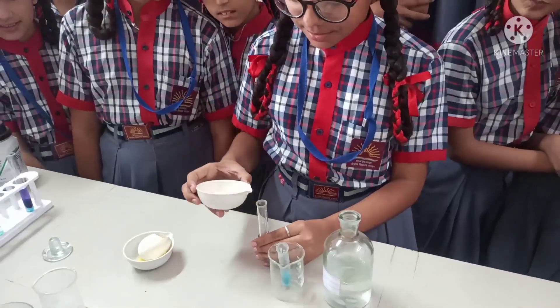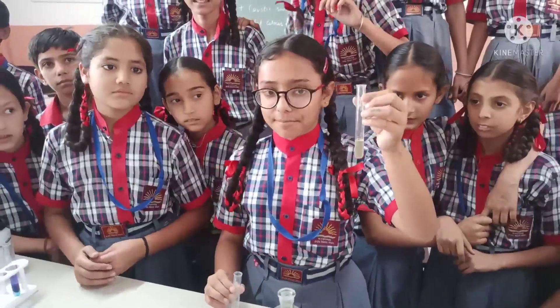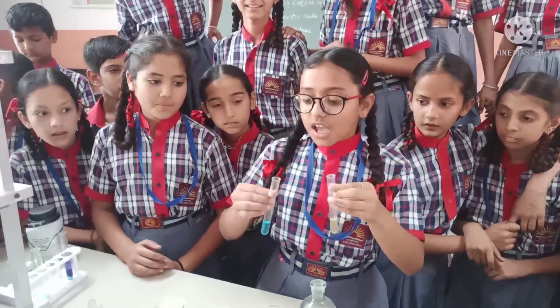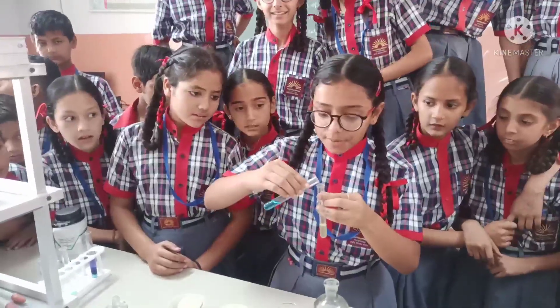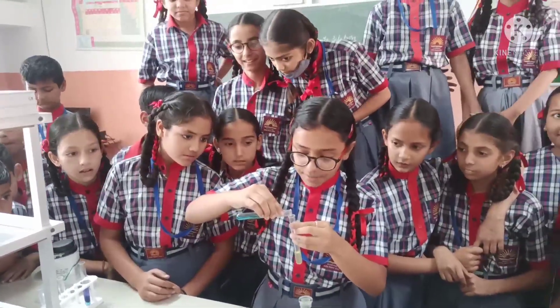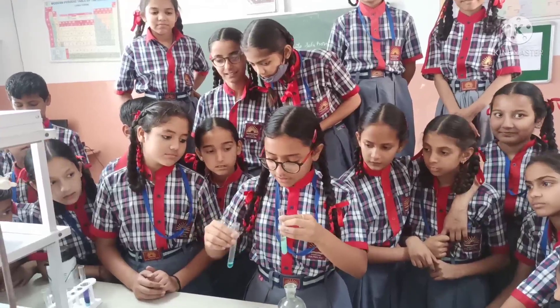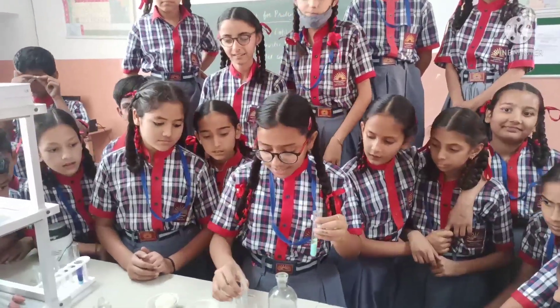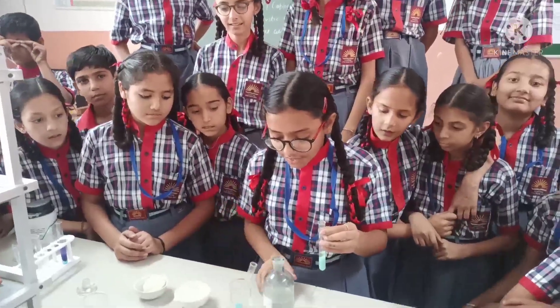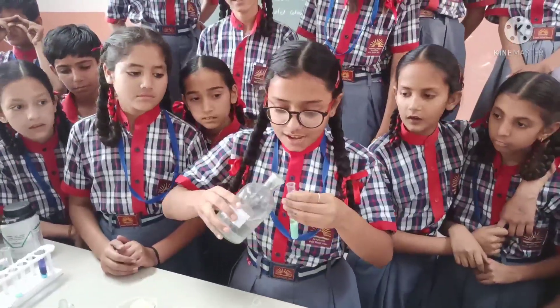We will add a bit. Here we can see the sample of protein and then we will add the copper sulfate solution in it a bit. Then we will add the caustic soda.